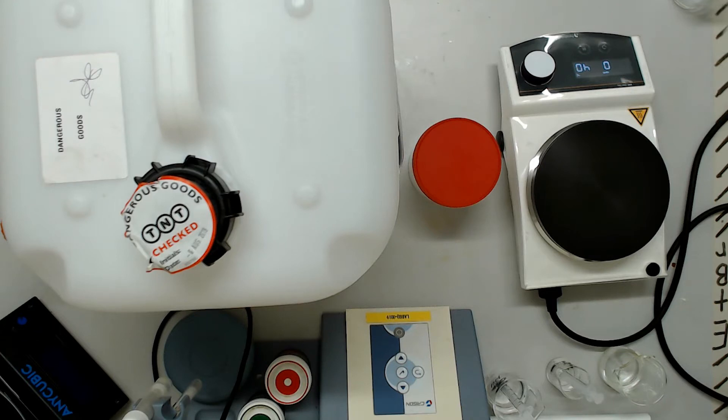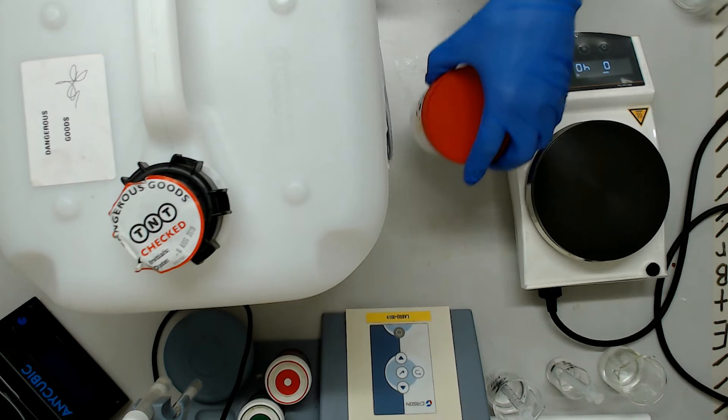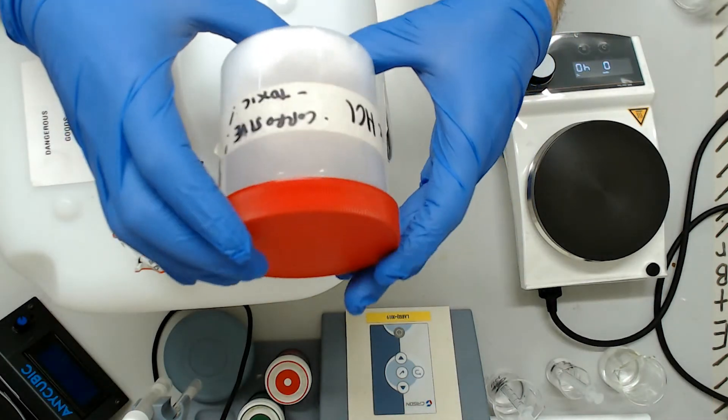Hello and welcome to the fourth video of our mini prep series, the one where we mix the rather unfortunately named buffer PB. Don't worry though, no plumbum today.